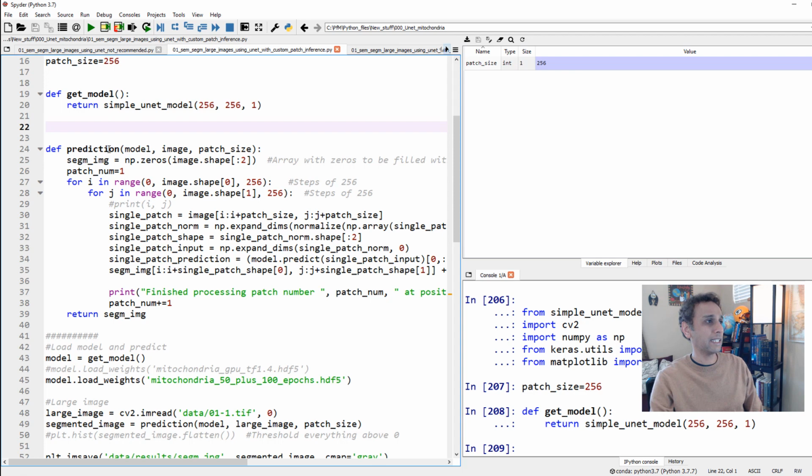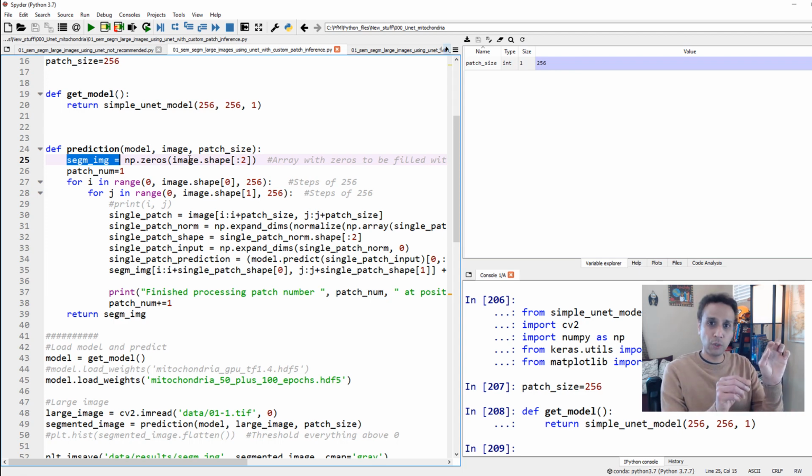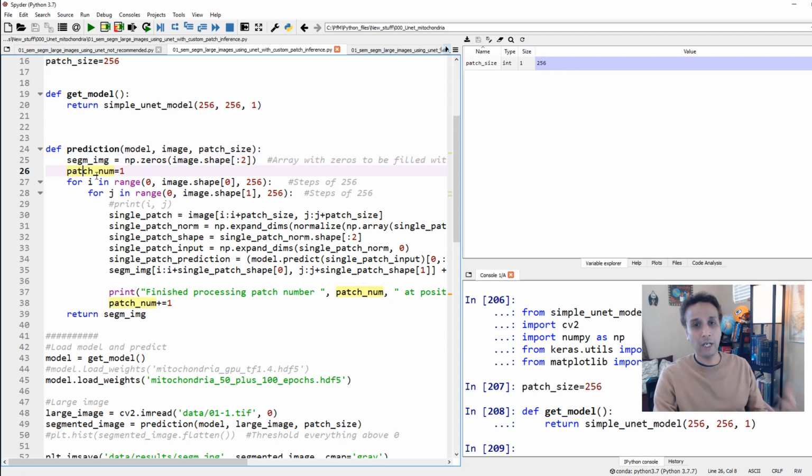Okay. First of all, let's go through line by line and try to make sense. I'm creating a NumPy array of the same shape as my original input image, but with all zeros. And this is where I'm going to replace zeros with whatever value after segmentation. Okay. So at least I have a placeholder. And I'm keeping track of my patch number, like, okay, how many patches, so I can print them out as it's going along.